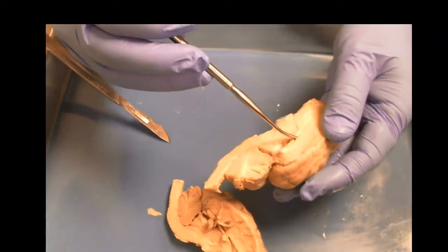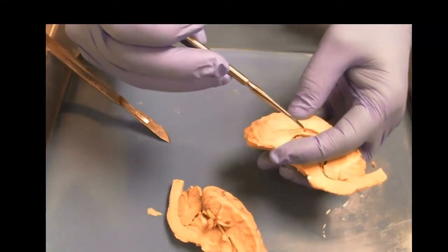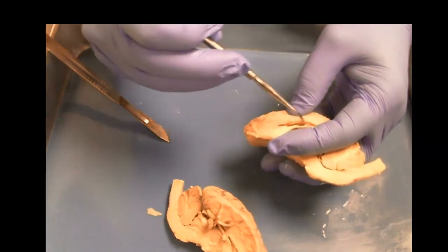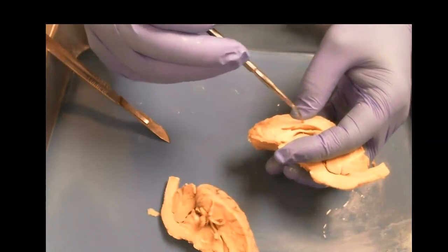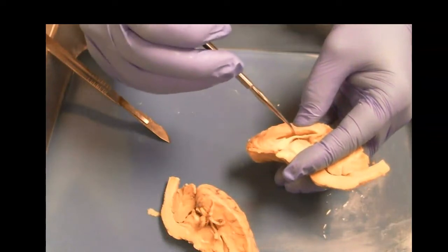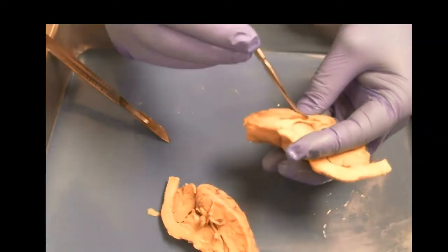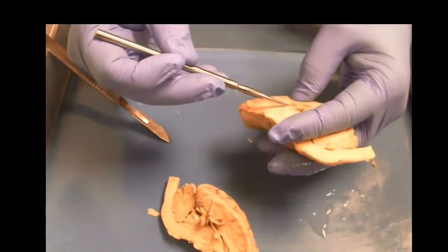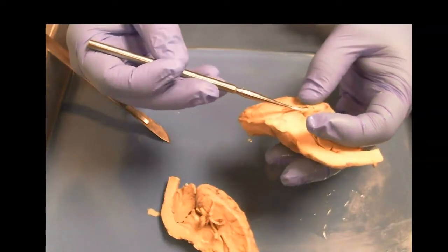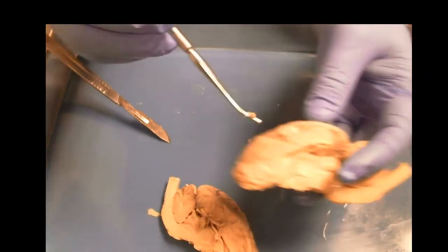Now, we want to start going through these structures, because on the outside we can look at the lobes, and we don't see much. We see this tissue covering the ventricles here, the septum pellucidum. And in here, this kind of empty space isn't really empty. It's just empty right now because there's no cerebrospinal fluid. But in here, sometimes we can even pull out this tissue, the choroid plexus, which is what actually produces the cerebrospinal fluid. So I just yanked this stuff out, and that's what that is. It creates the cerebrospinal fluid.